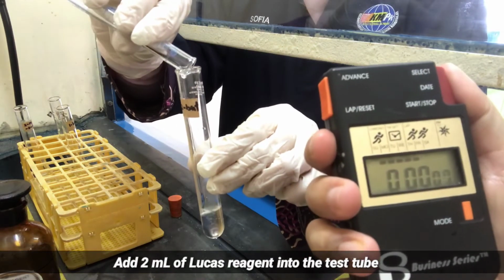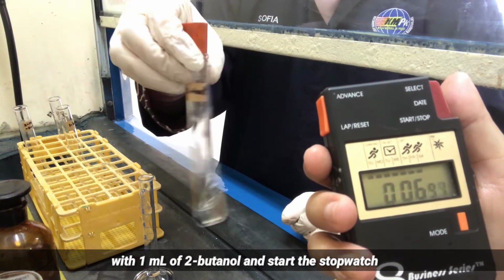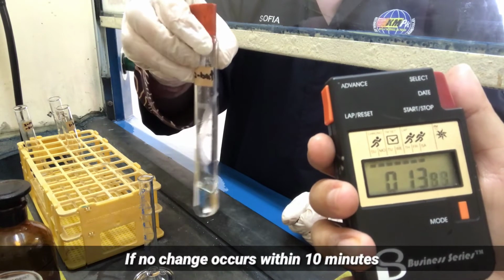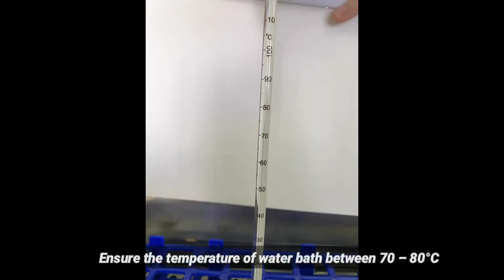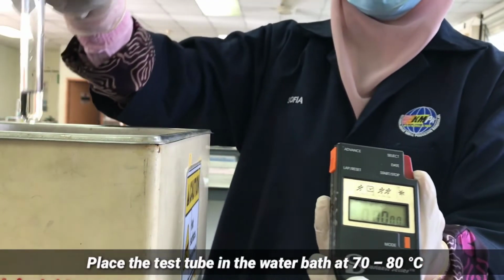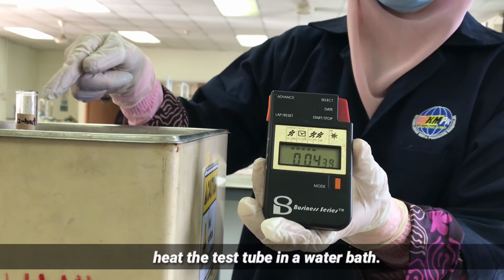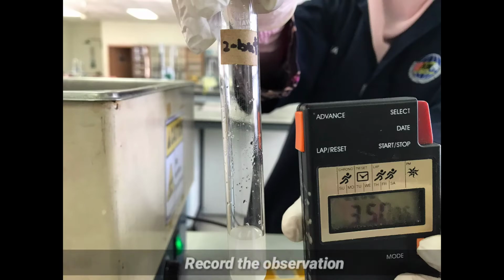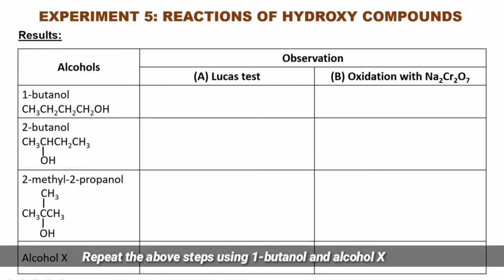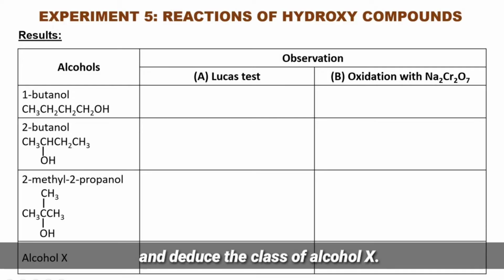Add 2 ml of Lucas reagent into the test tube containing 2-butanol and start the stopwatch. Stopper and shake the test tube. If there is no change within 10 minutes, place the test tube in the water bath with a temperature between 70 to 80 degrees Celsius. Start the stopwatch. Record the observations and the time taken for the solution to become cloudy. Repeat the above steps by using the rest of the alcohols and tabulate all observations. Deduce the class of alcohol X.